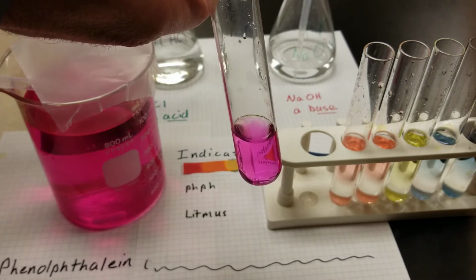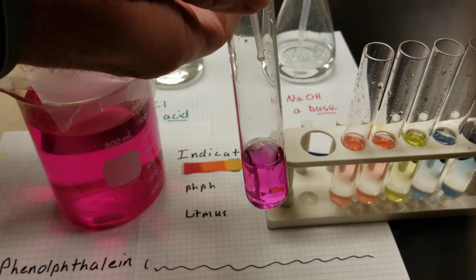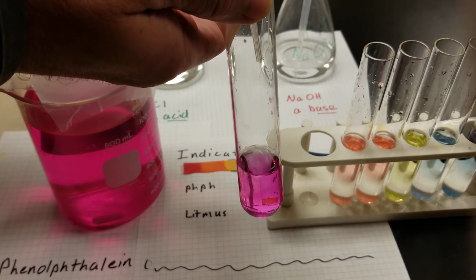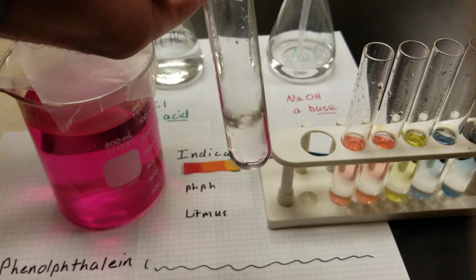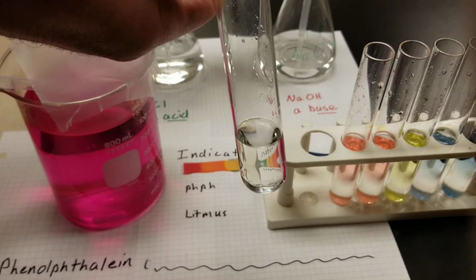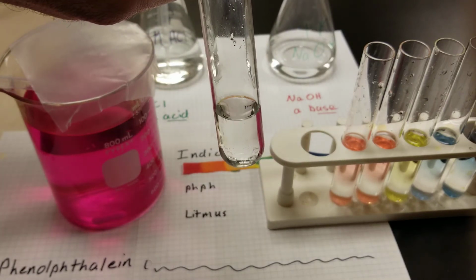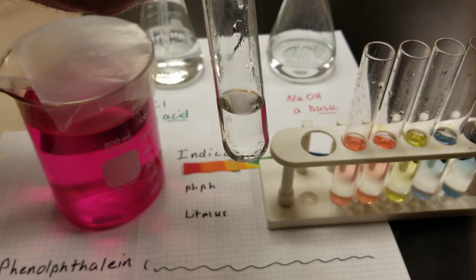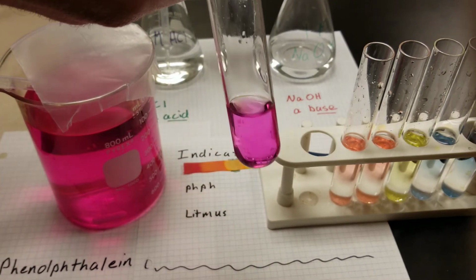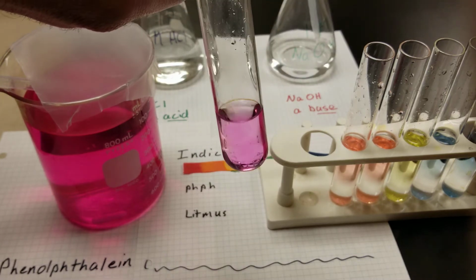So at first we neutralized our acid by adding base. Here I can add some acid back and neutralize our base as well. Just a couple drops there, and we neutralize our base. We undo its chemical effects. It's no longer able to turn phenolphthalein pink. If I add my base again, I can neutralize the acid and then have some base left over and allow the base to have the effect of turning that nice and pink.